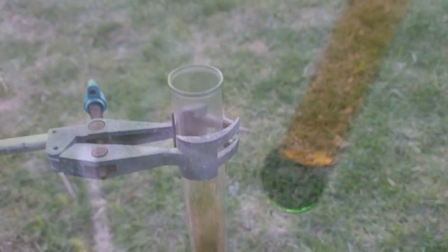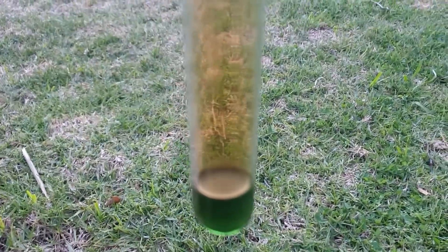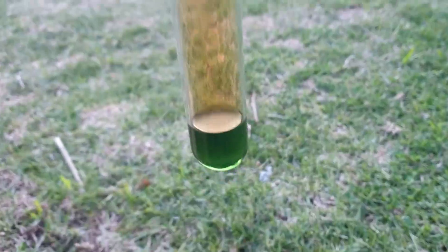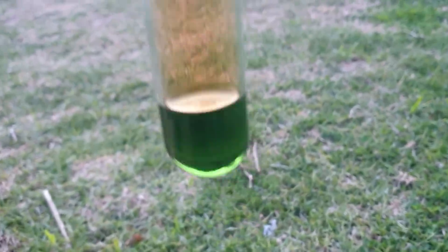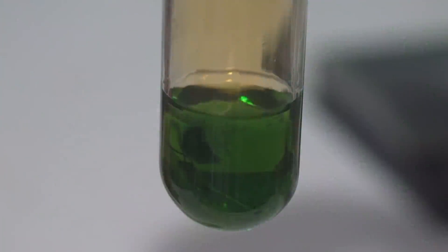It's quite warm. And it's got a lovely green colour. It's outside, obviously, because of the nitrogen dioxide, it was pumping out quite a bit for a little while. Nothing too threatening, but it's good to not do that indoors. I don't know if it's just gone that green because of the dissolved nitrogen oxides, so I might just dilute it up with a little bit of water and see if we can see that green colour a little better because it's lovely.